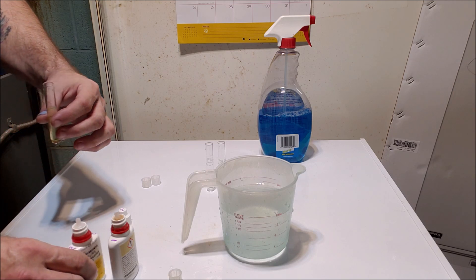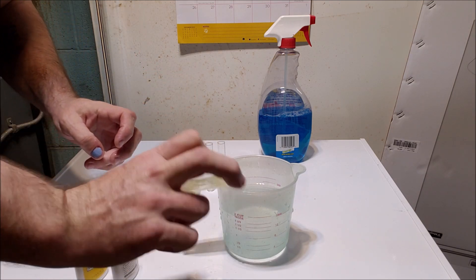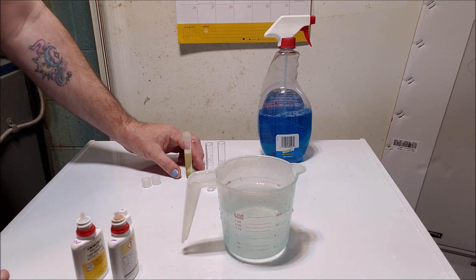We're going to put in eight drops of the second reagent and then we're going to mix that all around. So that'll be our control test.